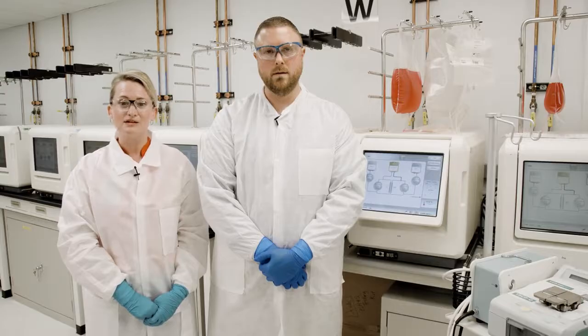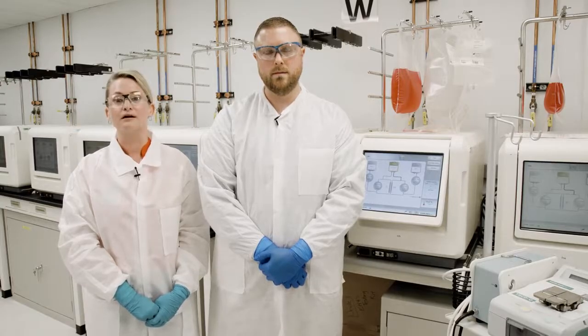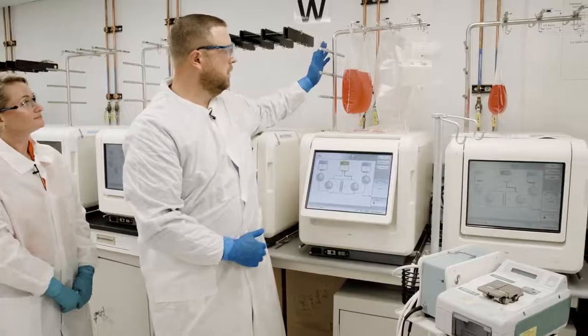The quantum we'll talk about today is a perfusion hollow fiber-based system. We continuously feed and remove waste at a rate that suits the cell culture process. Bags for media, PBS, and waste are hung on this back pole here.